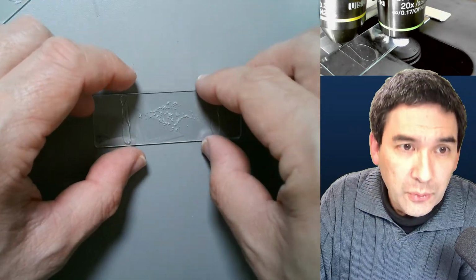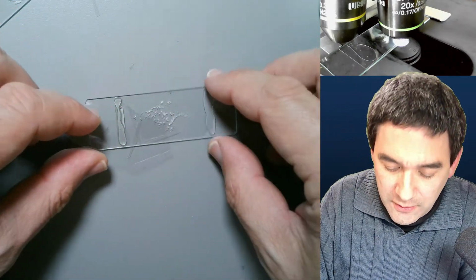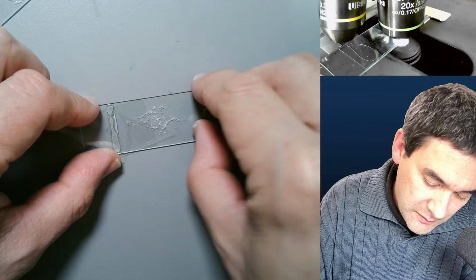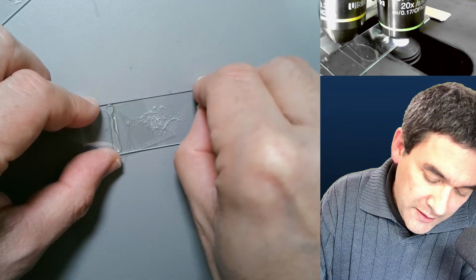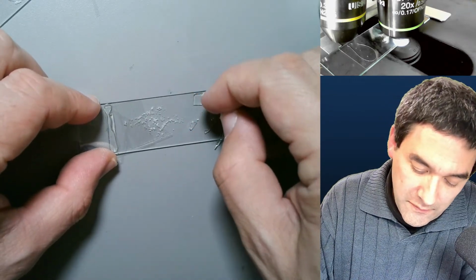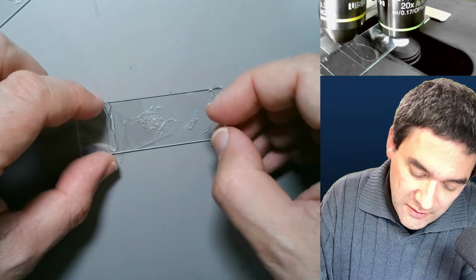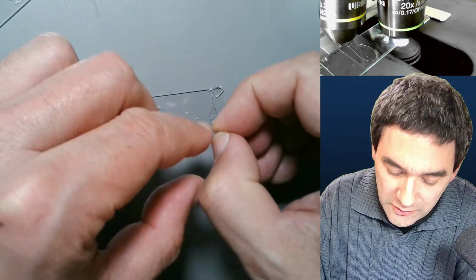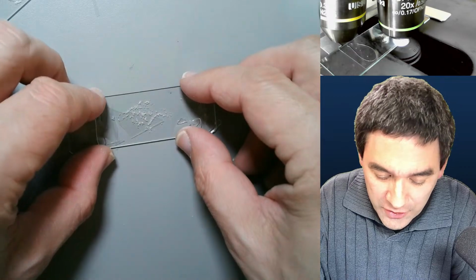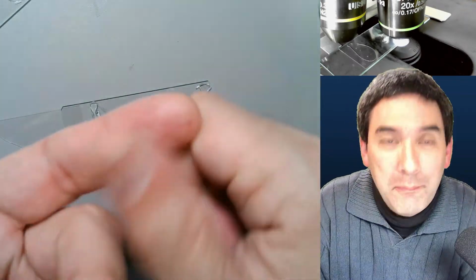I broke the cover glass. As you can see, if you apply the nail gel on all four sides, it's going to be pretty stable. I better not hurt myself. Yeah, I would say it's stable enough for all practical purposes. I probably would not make commercial slides using this technique, but for hobby purposes and for quickly protecting your slides, why not? You can actually see this way that something which was a gel before is now quite solid. But again, I have to be careful. Otherwise, I have another sample to put under the microscope, namely my own blood.